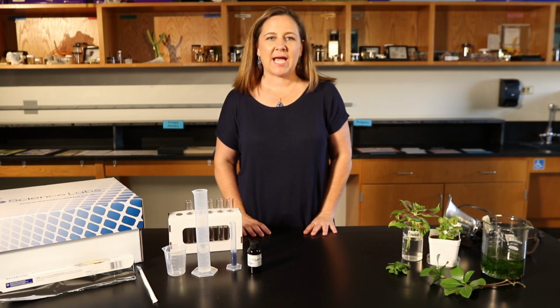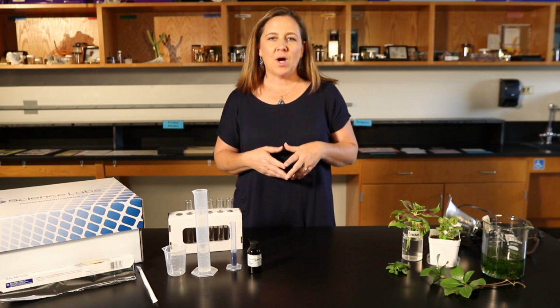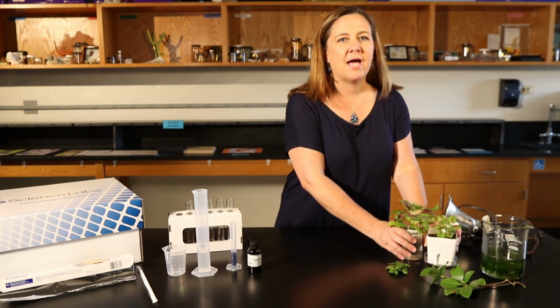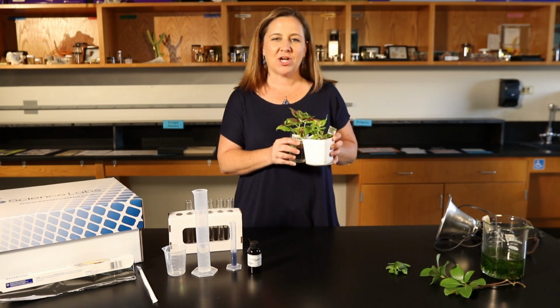In this experiment, we'll observe the role of carbon dioxide in the photosynthesis reactions. As these photosynthesis reactions occur, plants convert carbon dioxide into carbohydrates, stored energy we call food. While oxygen gas is a product of the light reactions, carbon dioxide is a reactant for the Calvin cycle. We will use live plants to observe changes in the concentration of a gas, carbon dioxide.